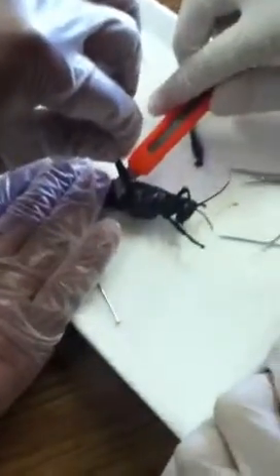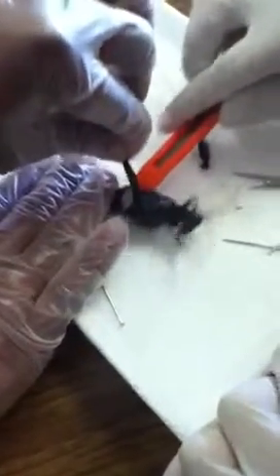You have to make them into like a larva. Or nothing. Okay, if you guys are at the point where you've got all the legs and the wings off, we're going to move on to making the incision. Get the little ones — yeah, it'll be hard. That's what she said. That's what that grasshopper, or the locust, said.